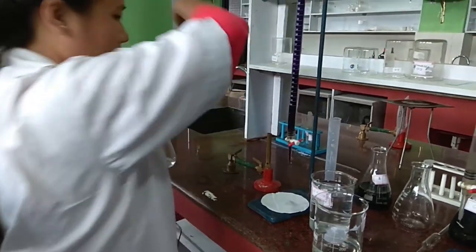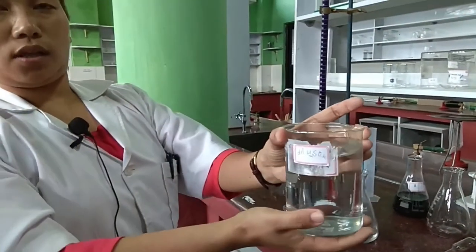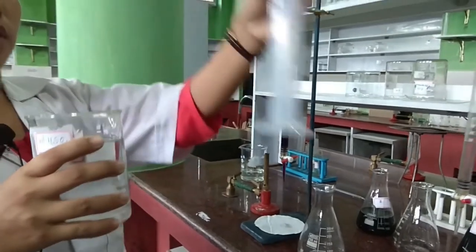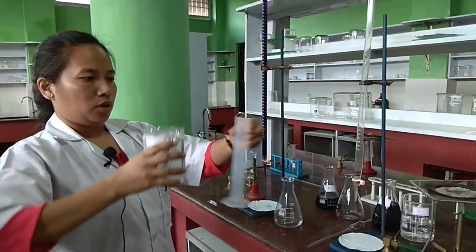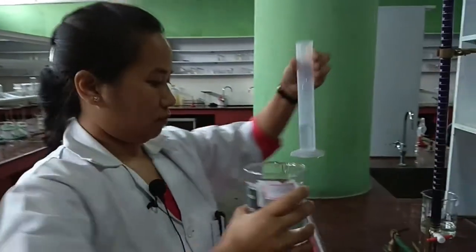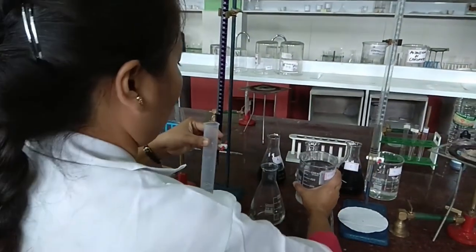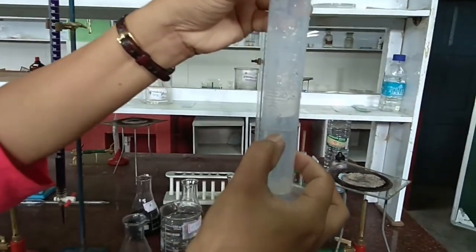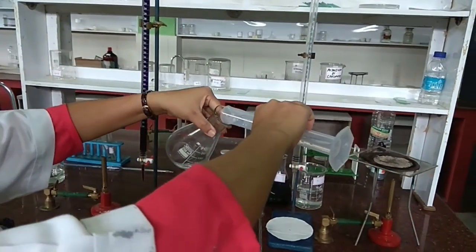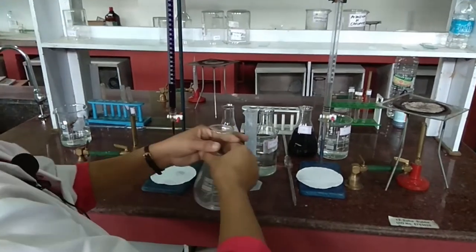Now put aside your pipette and your solution. Take dilute sulfuric acid, and with the help of a measuring cylinder, measure 20 ml of this dilute sulfuric acid. Transfer it into the conical flask where the ammonium iron 2 sulfate solution is already present, and swirl it once.